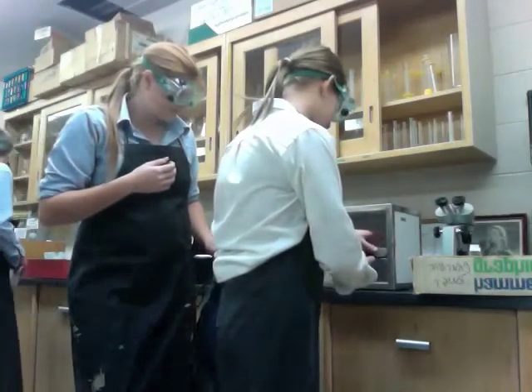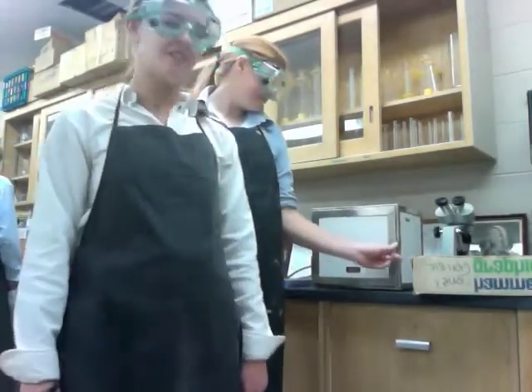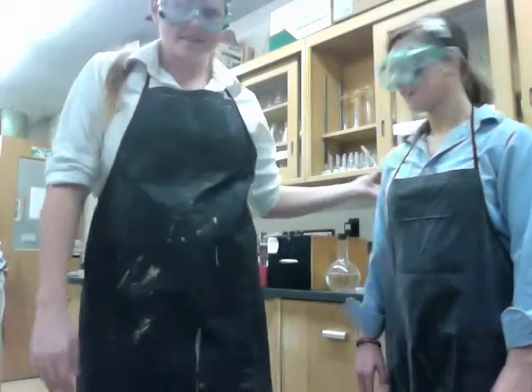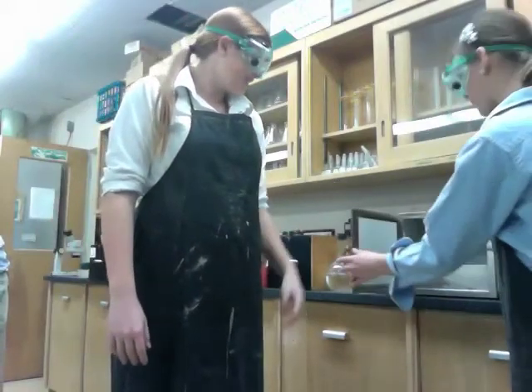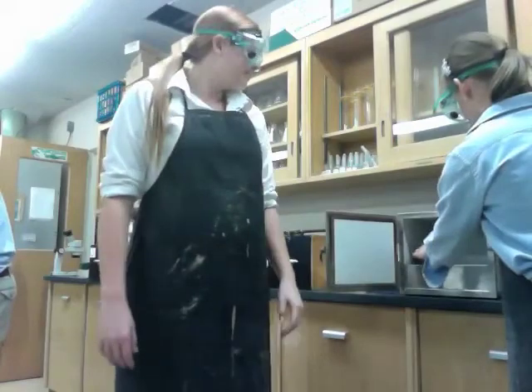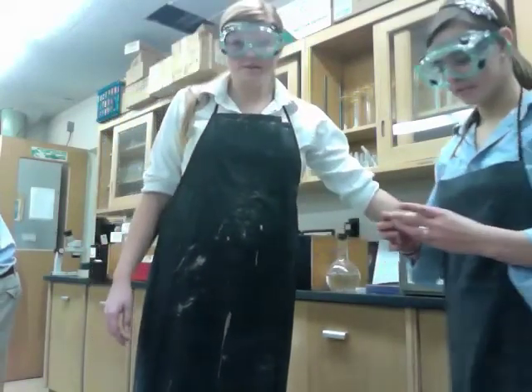They're not all going to fit in there. And we're going to leave it there overnight and see it tomorrow and see if the water evaporates, leaving just the salt. Now, after you put your water in the oven overnight, you have to take it out. And after you've taken it out, you have to weigh it, because all the water should be gone.